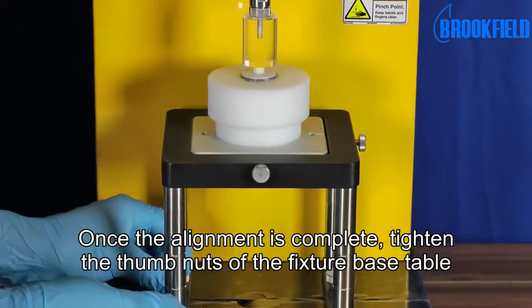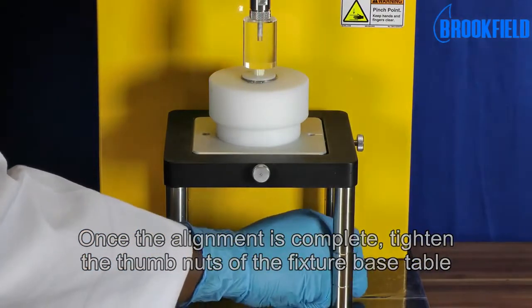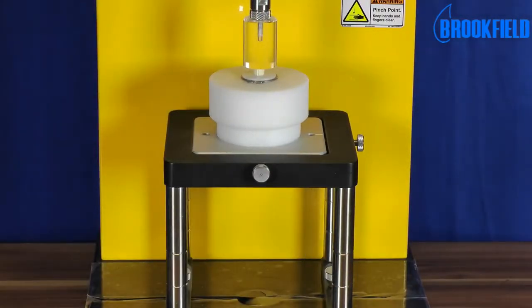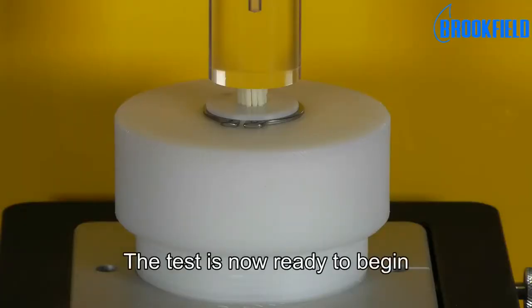Once alignment is complete, tighten the thumb nuts of the fixture base table. The test is now ready to begin.